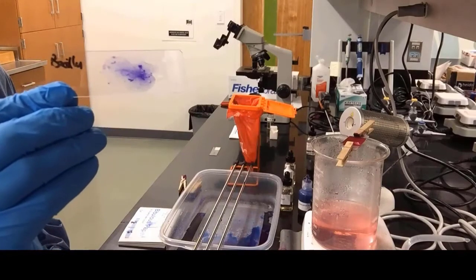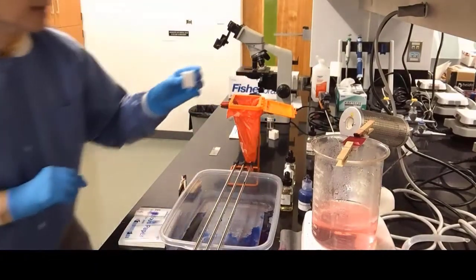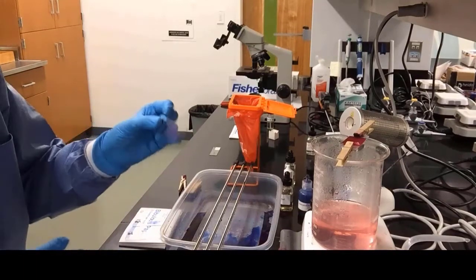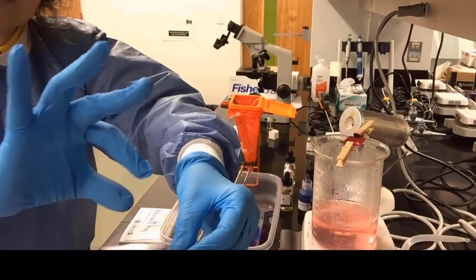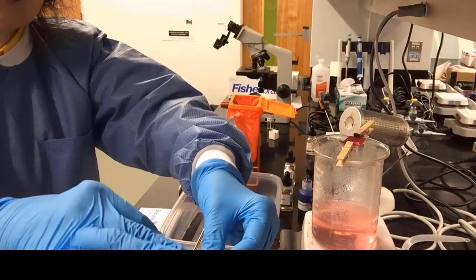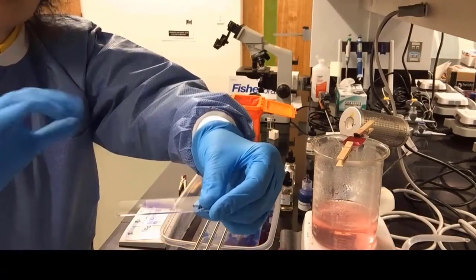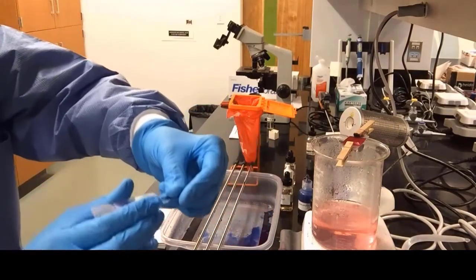So we do not want to get stain onto our lens or bacteria, so we will be using a cover slip for each slide. All you have to do is place the cover slip on top of the specimen. You can see the cover slip, it's a little square piece, and move it so it covers your whole specimen. And now we are ready for the microscope.